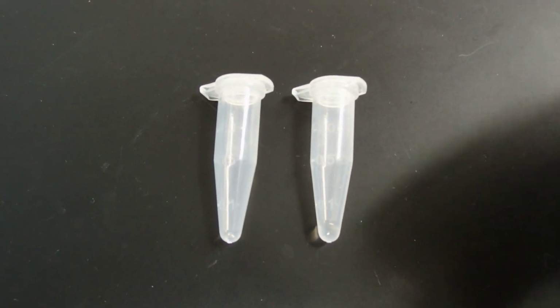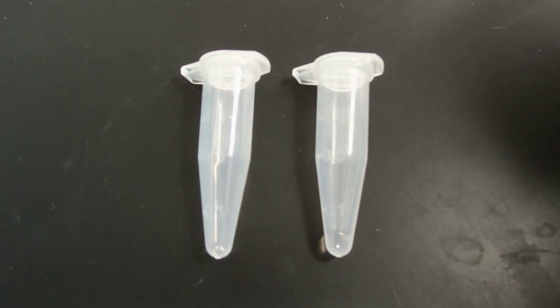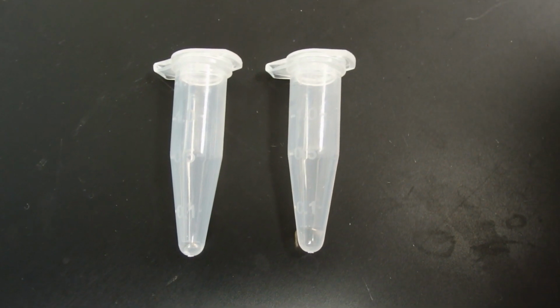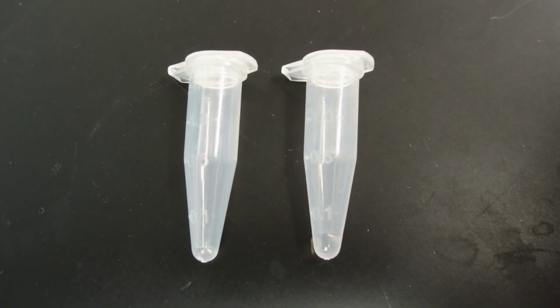If you wanted to further purify the DNA and get rid of the TAE buffer and the ethidium bromide and things like that, you could phenol chloroform extract this DNA and then you would have ultra-pure DNA. However, I've cloned lots of genes just directly by using that liquid.